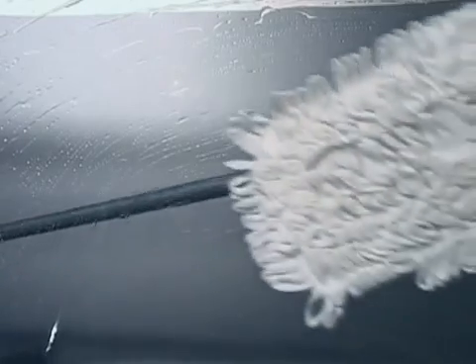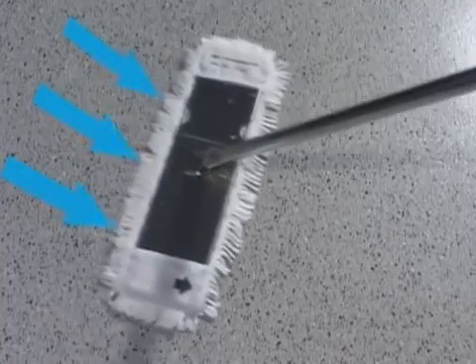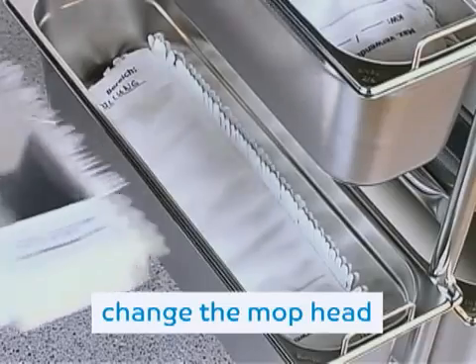You've just heard it. The mop head needs to be changed after approximately 10 square meters. You will also notice it by the mop becoming stiff. Of utmost importance, the used mop must under no circumstances be soaked again. The in-use solution would be contaminated.